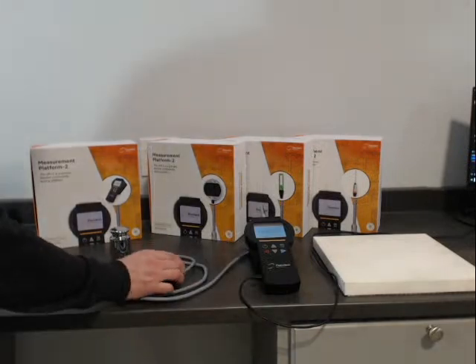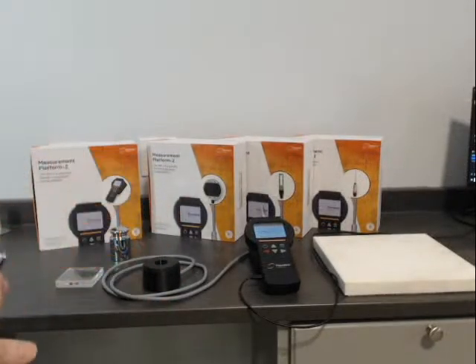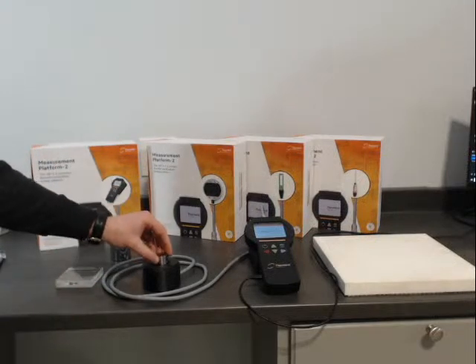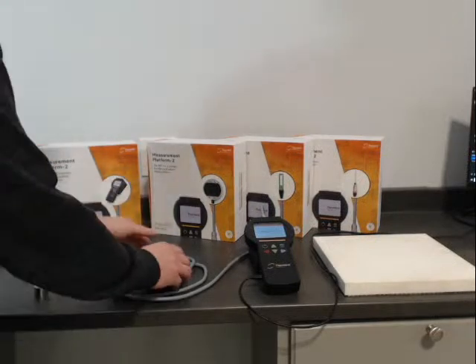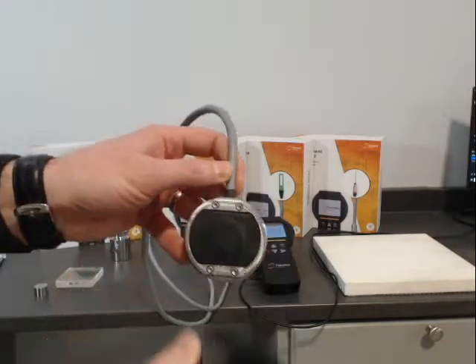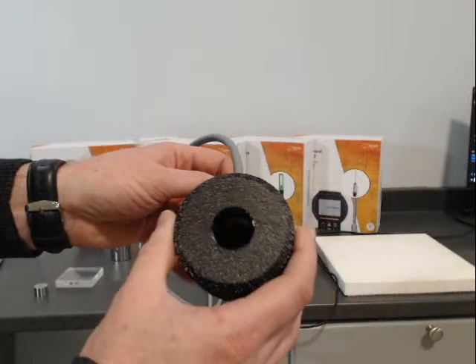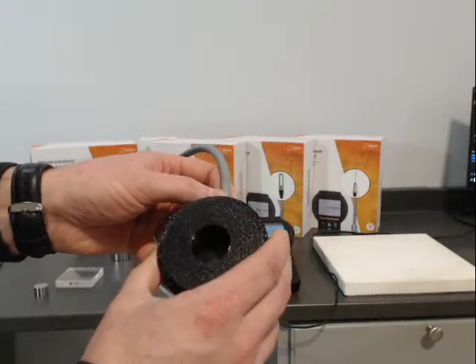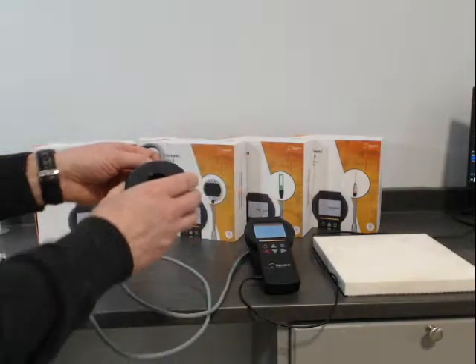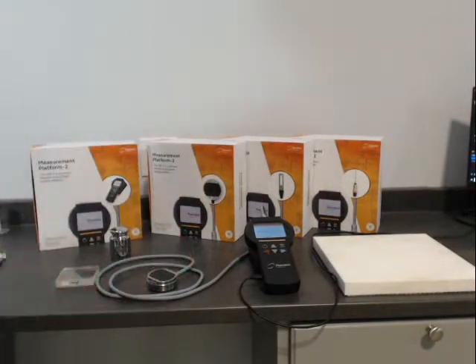This fits snugly on top. You would put paste or powder in that, and if you wanted some pressure, you could put that weight down. You end up with a small cavity — about one inch diameter by about one inch height — and that's how we contain the sample. Pretty simple device.